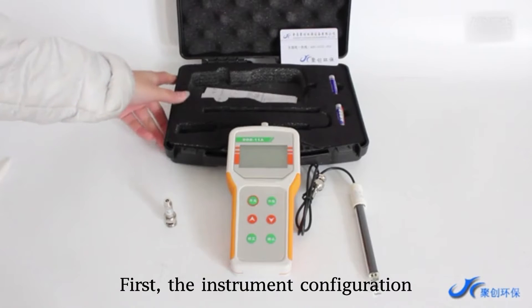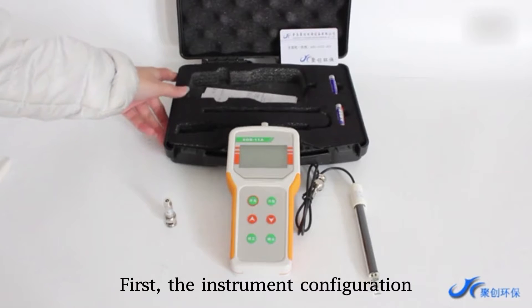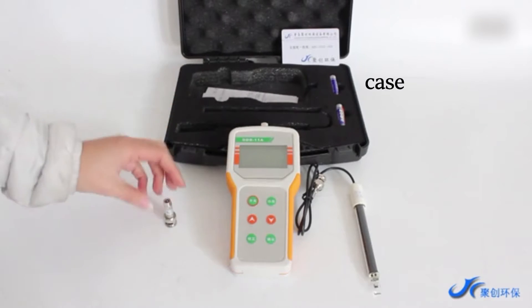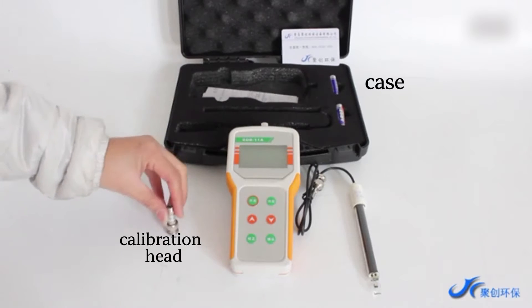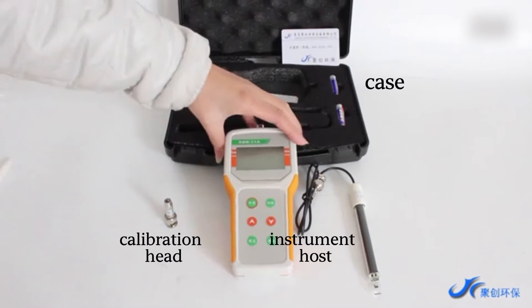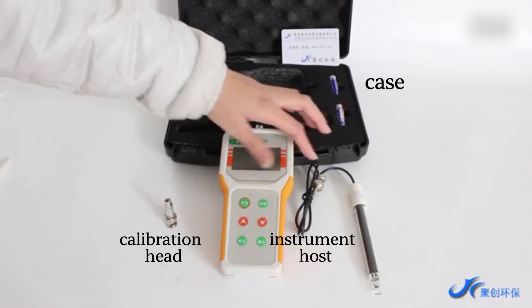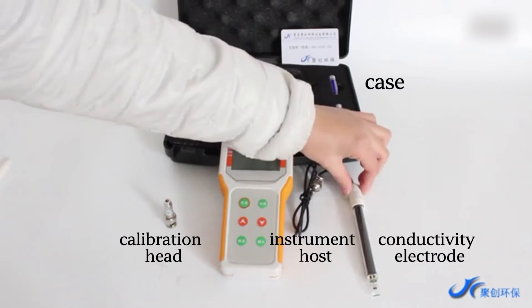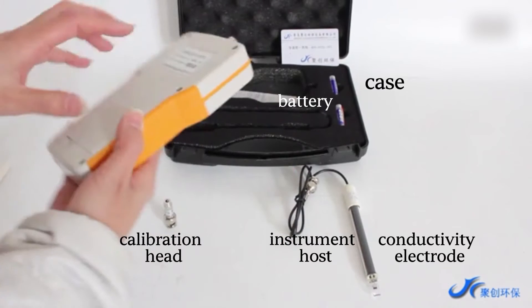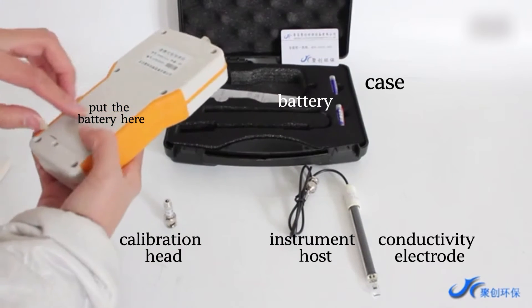First, the instrument configuration: case, calibration head, instrument host, conductivity electrode, battery, etc.